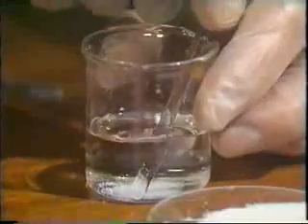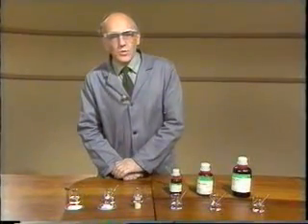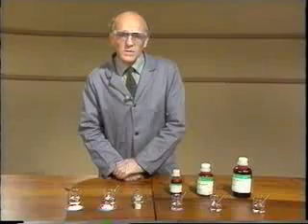So if the rule of like dissolves like applies, then we might expect ionic substances not to dissolve in hexane, whereas the covalent substances perhaps will. Let's try the rest, and this should enable you to classify these chlorides as covalent or ionic.